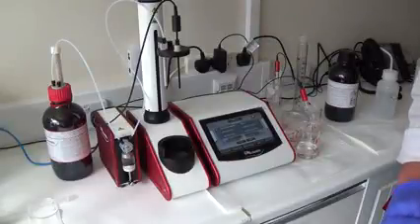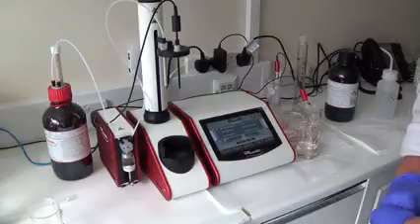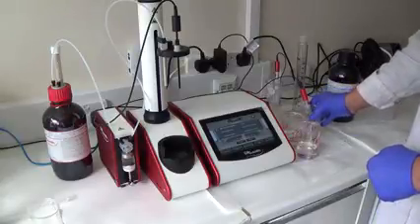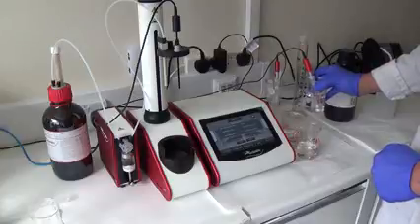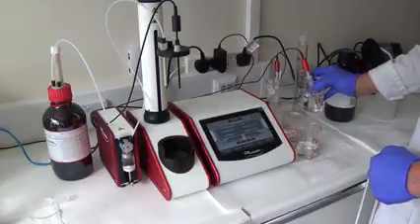So now we're going to go through running a TAN sample. We've gone back to our homepage. Our electrode has been conditioning in water for about five minutes in between samples.